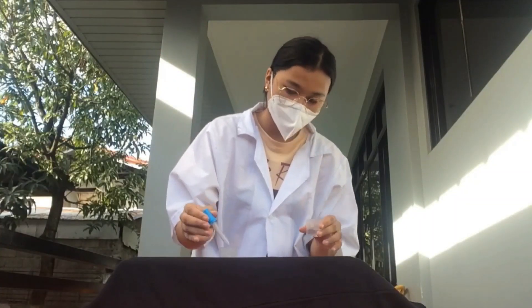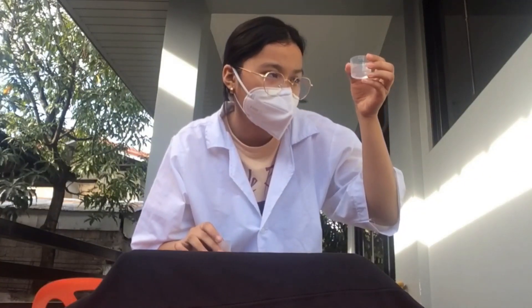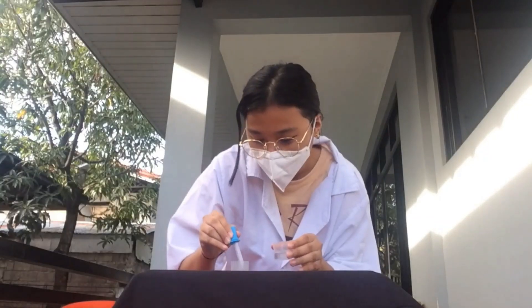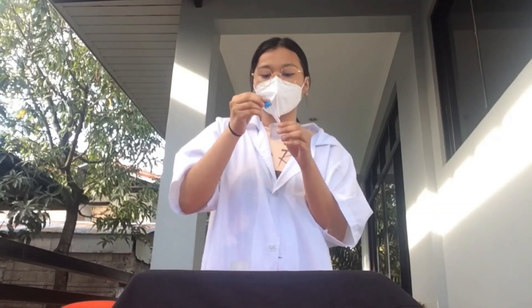In this process, I use an empty cup, a cup with 10 mL of water, and a medicine dropper. I have compiled videos of me doing this process.